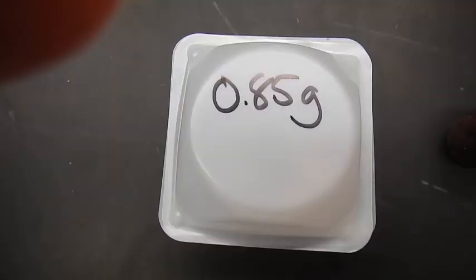Distilled water? Why distilled water? What happens if you rinse it with distilled water? I'll tell you this. You don't want to rinse it with distilled water. You want to rinse it with the acid. Oh, you want to rinse it with the acid, right? Because so then it... And why don't we want to mix it with distilled water? What if we had mixed it with distilled water? What would happen? There would be excess H2O to... Yeah. It would be diluted. The acid would be diluted.